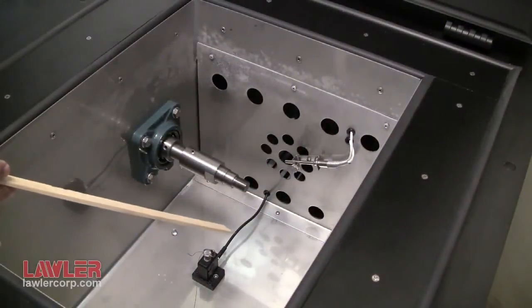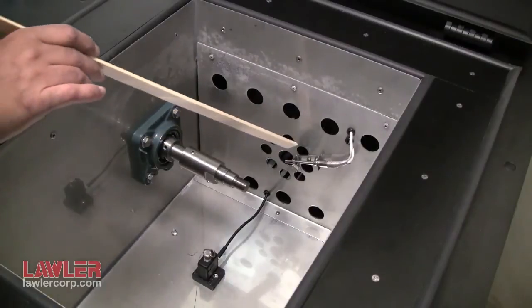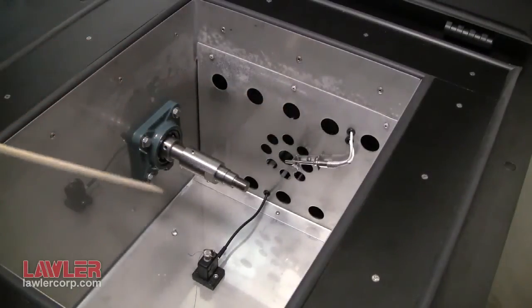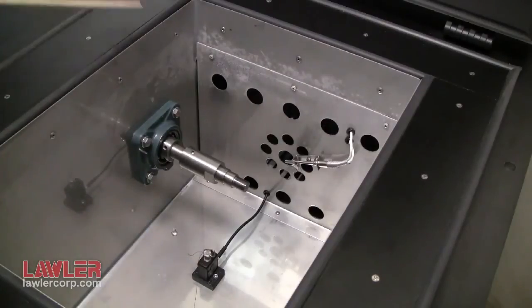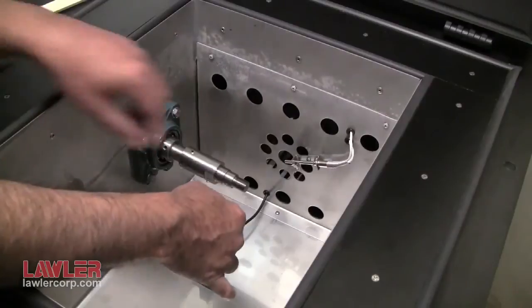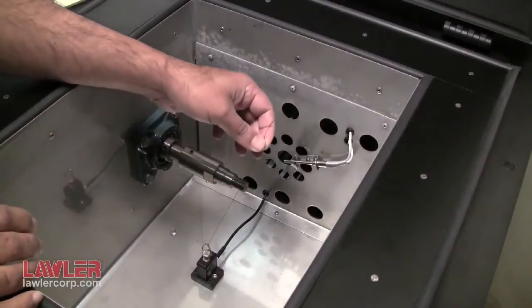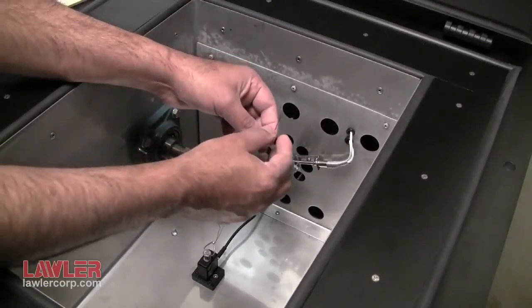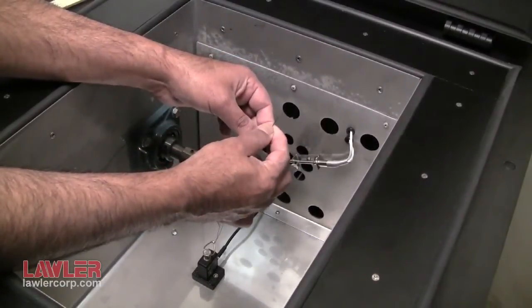Here we have the air chamber with the lid open. In it you can see the bath temperature probe, behind it the blower, down below the load cell. The load cell is set up for D1478. It has a thin braided 30 pound test fishing line, at the end of which is a small loop, hopefully visible here.